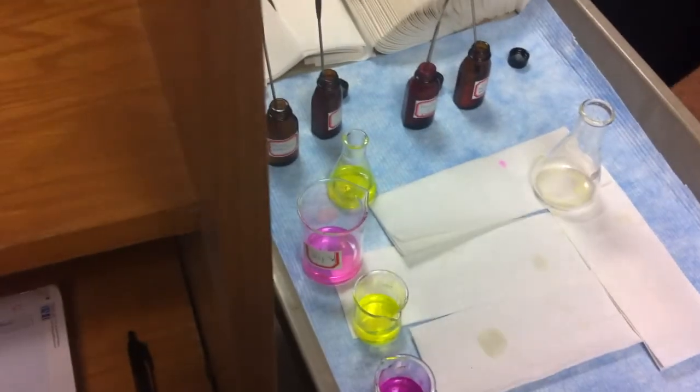Okay, this is the order that they're produced. So you go light blue, purple, yellow, bright yellow, that's kind of a lavender, and that was more of a yellow. These three seem to really glow a long time. That was really cool. All right, all these solutions then go into the jar and the hood.